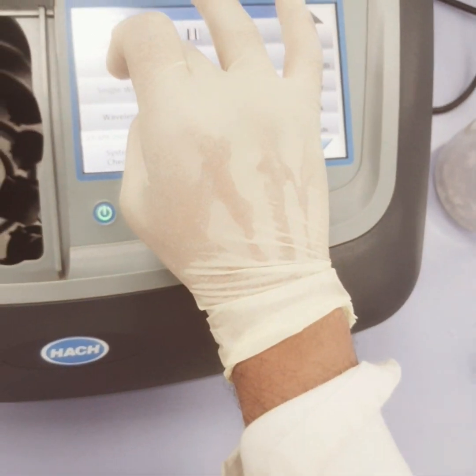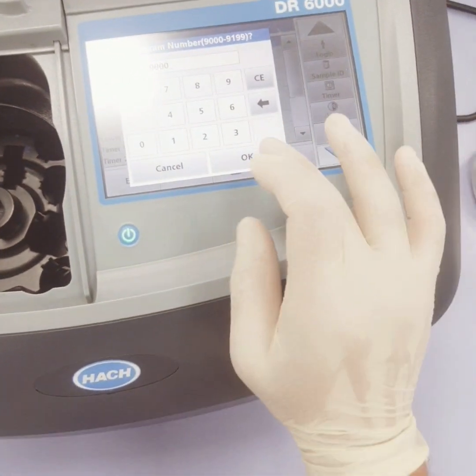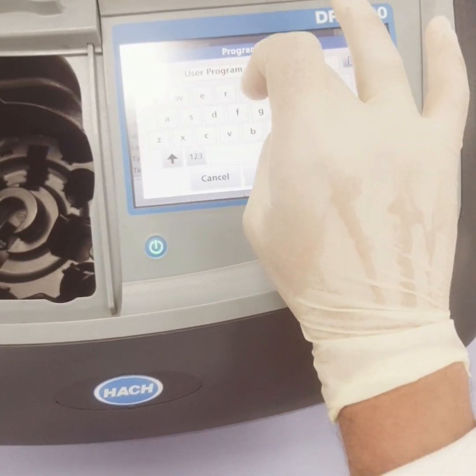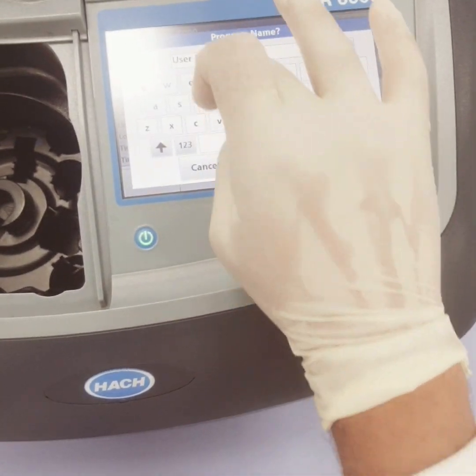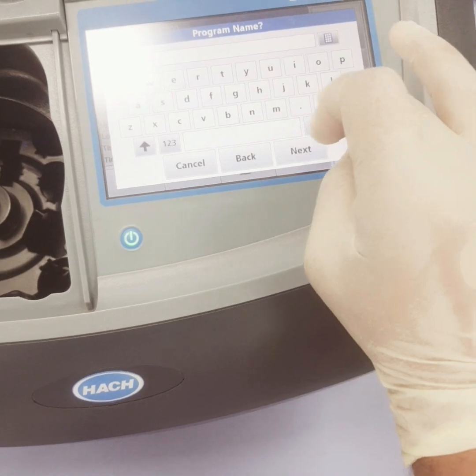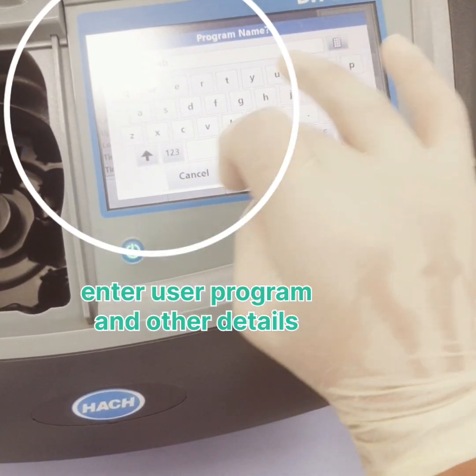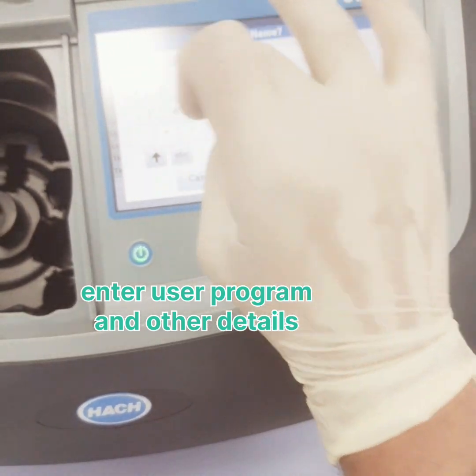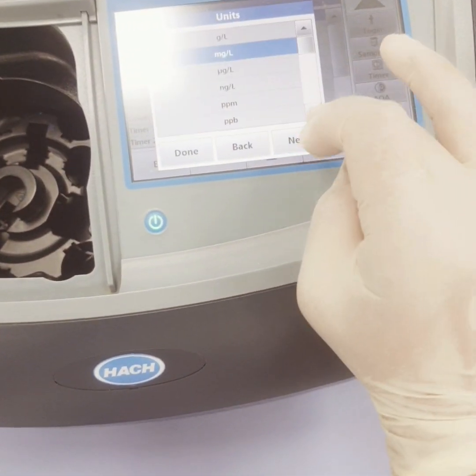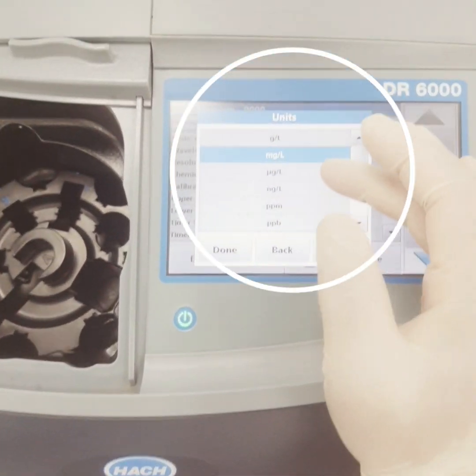Now based on this I will choose user program and I will say program options and I will say new, and then we can give a program number, and then user program, for example I would say AB 92, next. This is single or multi, so I will say single, next, and then the concentration unit is milligram, gram, microgram. You can make your different concentrations for calibration.